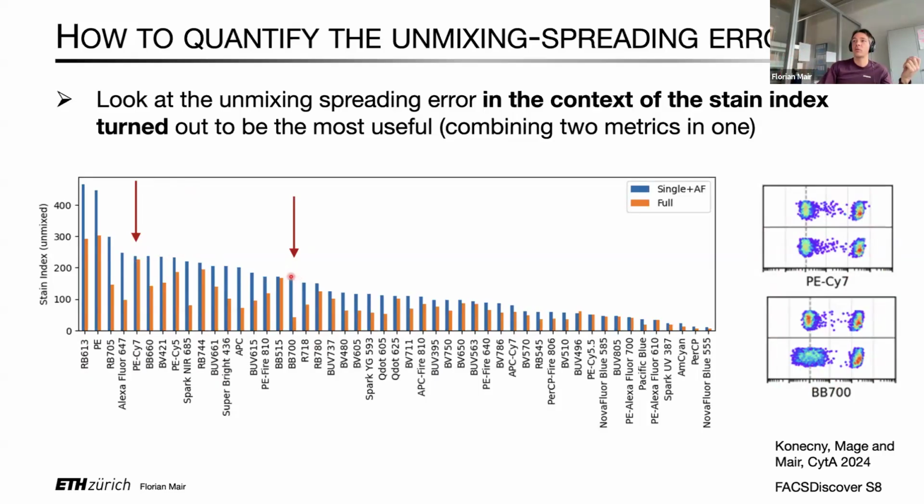While for Brilliant Blue 700, you would see quite a drastic decrease in the stain index because of that increase in variance or noise in the negatives. And then you can, of course, go and you can just order that adjusted stain index, in this case by the height of the orange bars, and then this would tell you how well you're still able to resolve for a given fluorochrome in the context of the 50-color unmixing matrix with this effect of unmixing spreading error. And this turned out, at least for us, a useful way how we could design the marker assignment for the 50-color panel as we published it in the end.